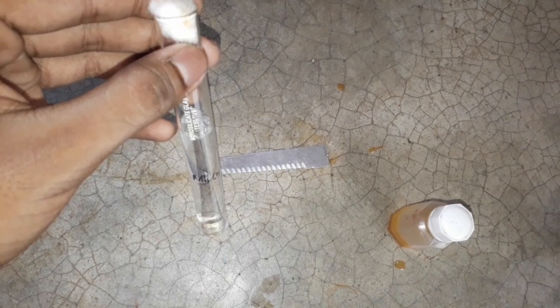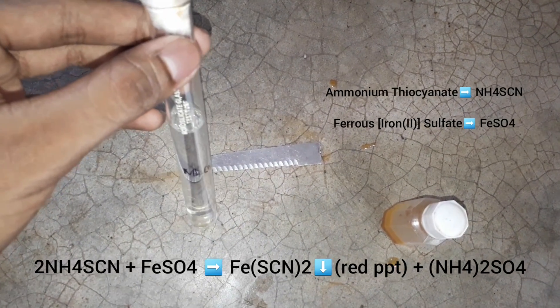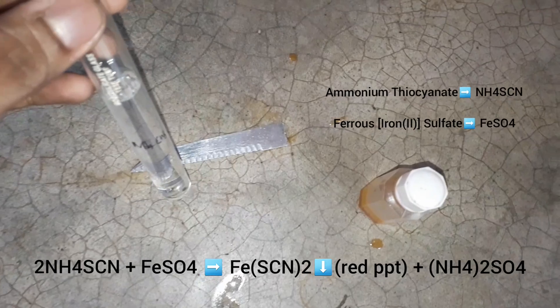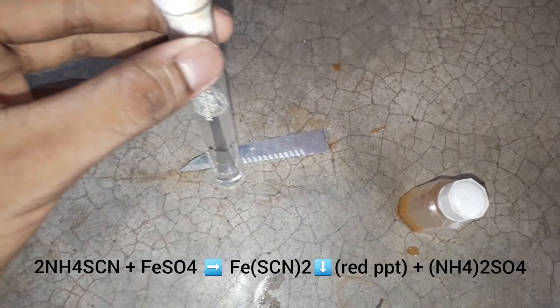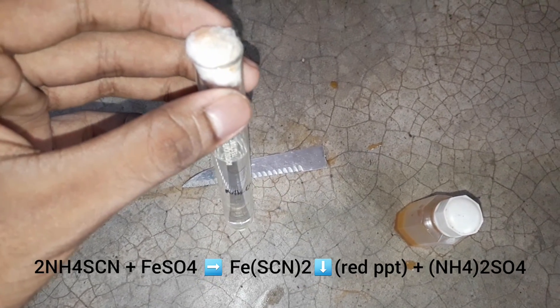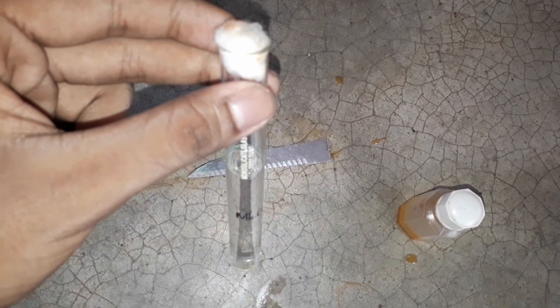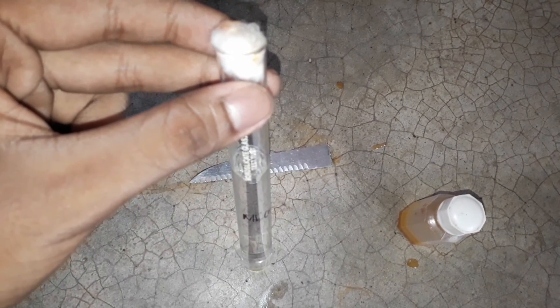What really happened: NH4SCN, or ammonium thiocyanate, reacted with FeSO4, or ferrous sulfate, to produce ferrous thiocyanate, which is red and acts like blood, and ammonium sulfate as a side product.